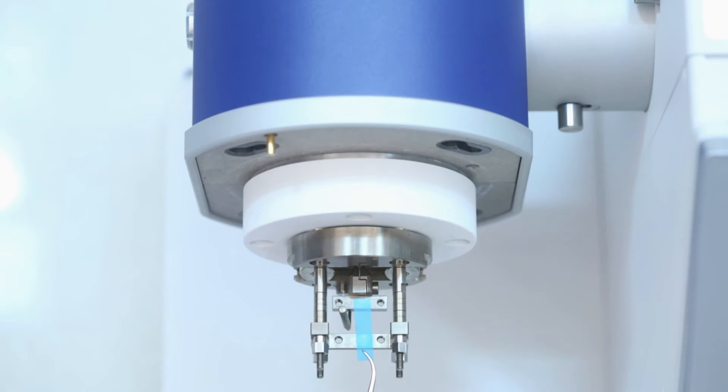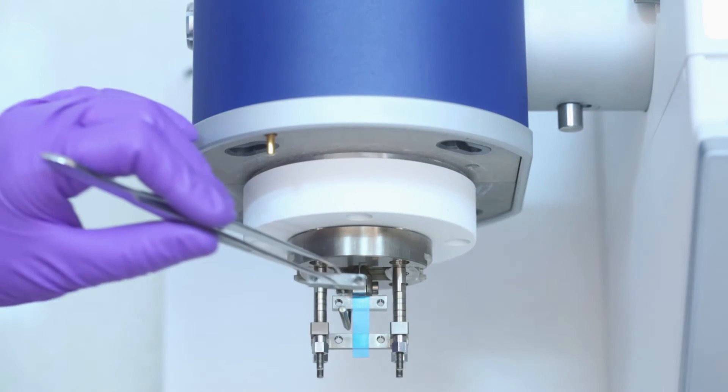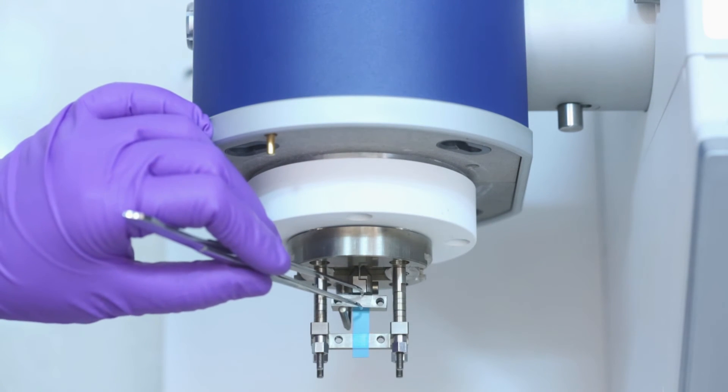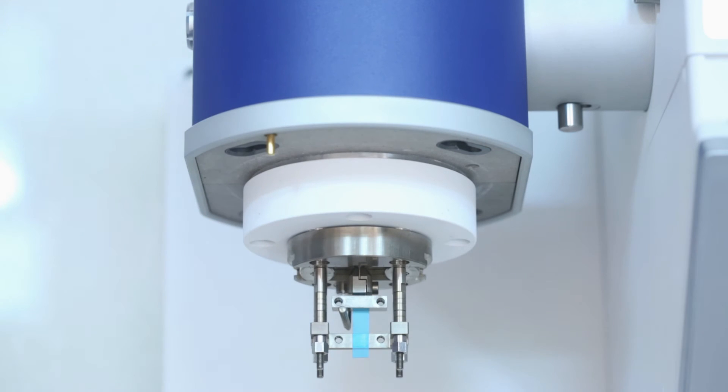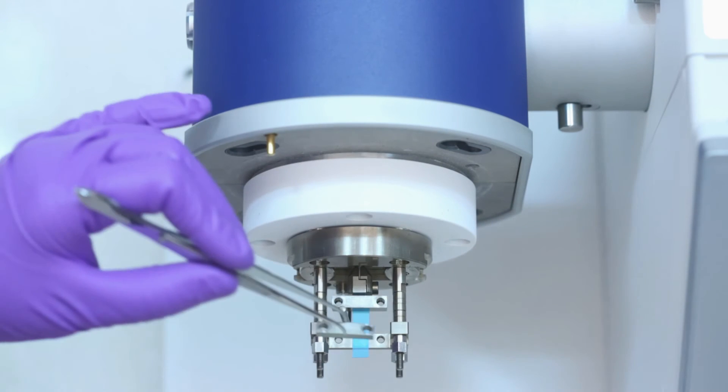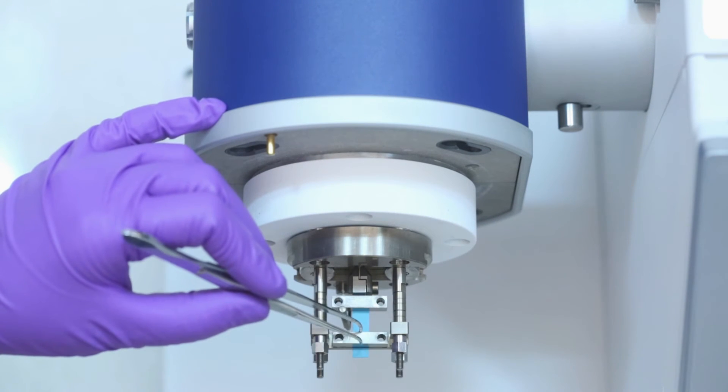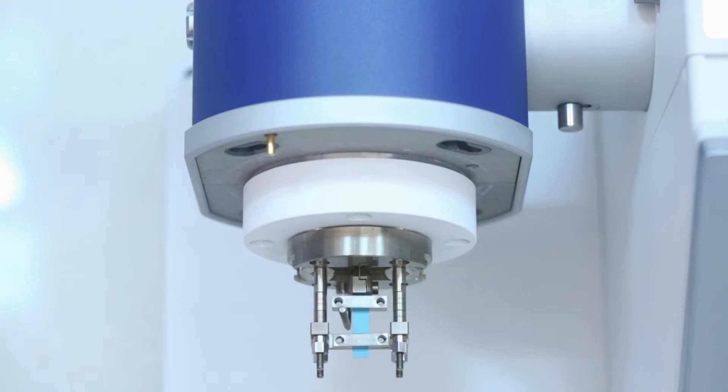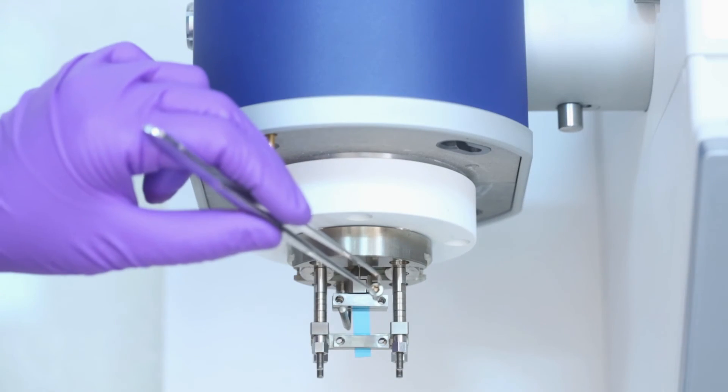Place the sample in the clamps. Fit the two clamp bars and screw the four screws.